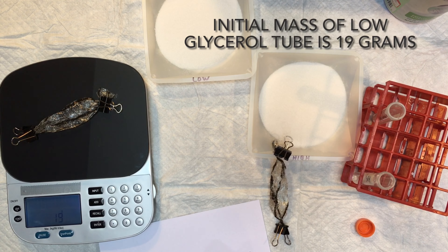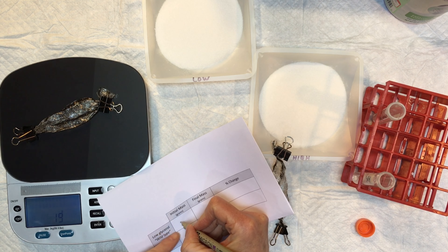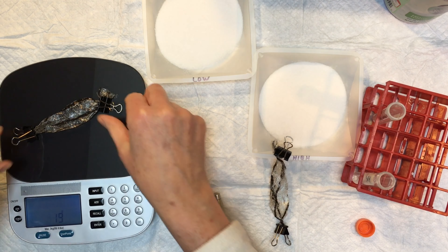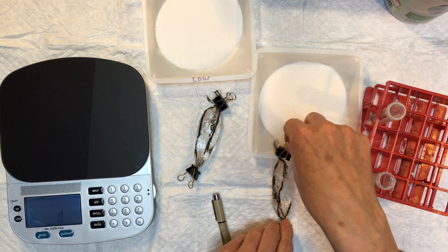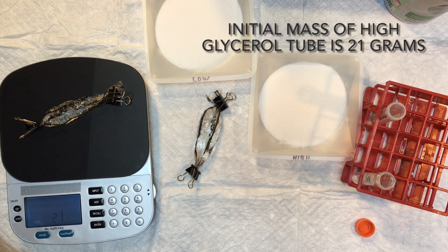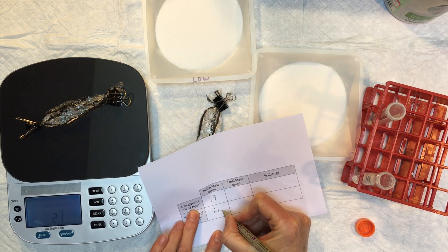I'm going to put that on the data table — our initial mass. That's today's mass. And our high glycerol solution weighs 21 grams, so I'll put that again on our data table.